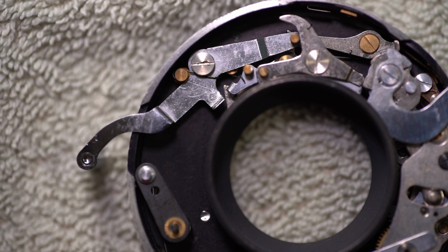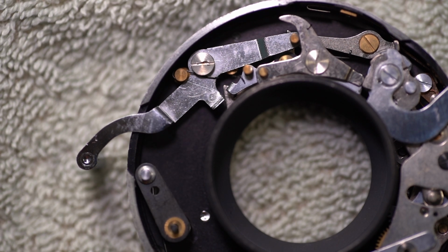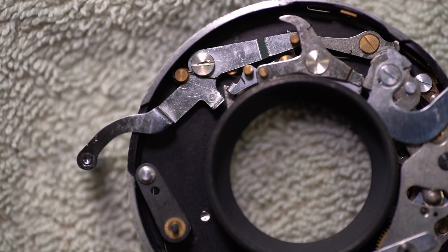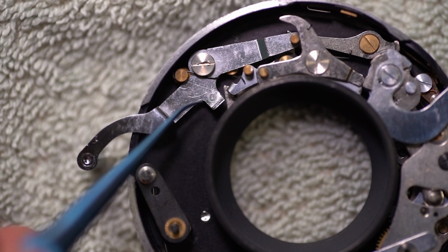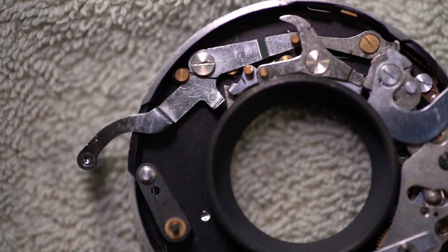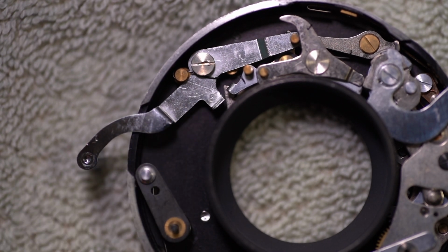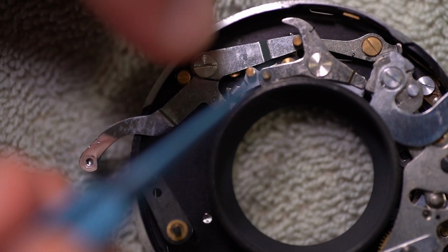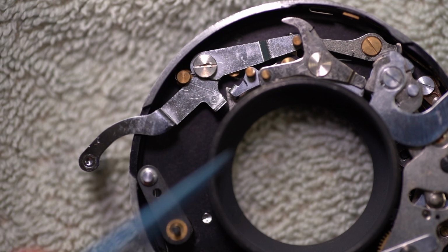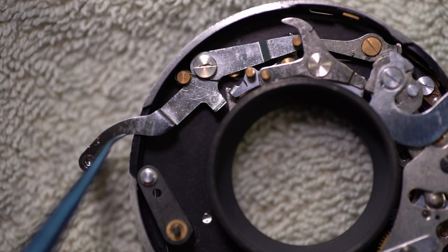I don't know if they welded it on or if they punched it out or what, but anyway, you can see a little bit of a difference here, where that pin is attached on the bottom side. But that hits that little angled piece and shoves it over, which activates the rest of the mechanism, does its thing, and opens this and closes it. Well, opens it, I should say. To close it, there's a different thing that this also actuates.